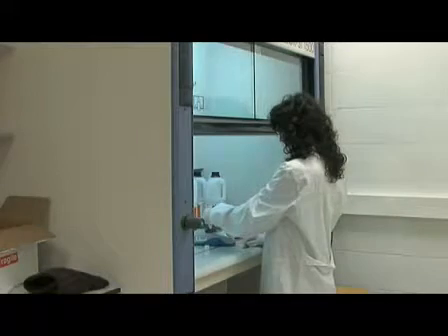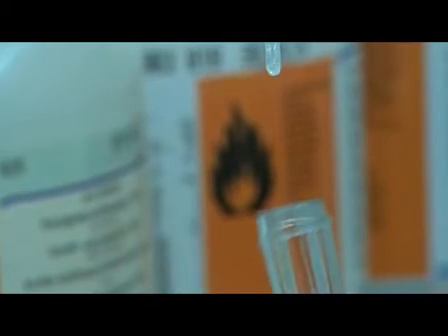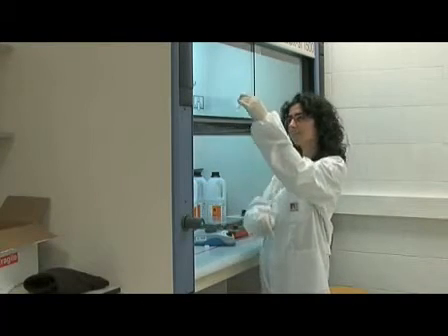When this occurs, more methanol acetic acid must be added. The final volume should be adjusted according to the cellular dispersion that you want to obtain in further extensions.